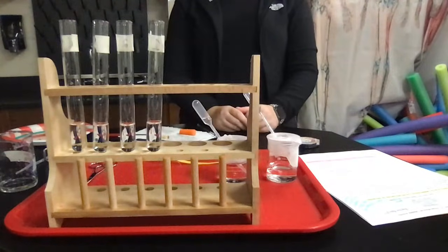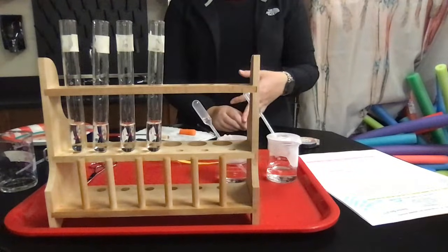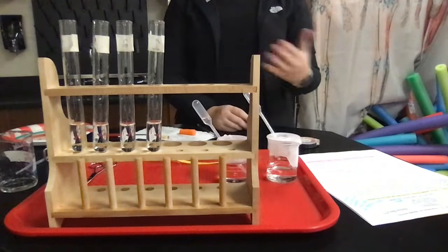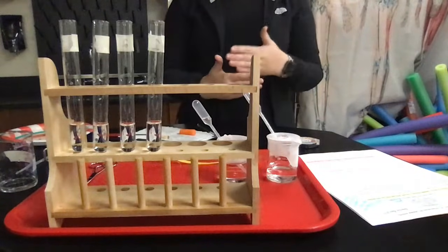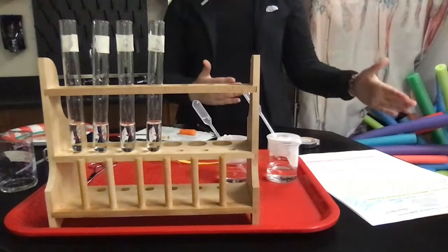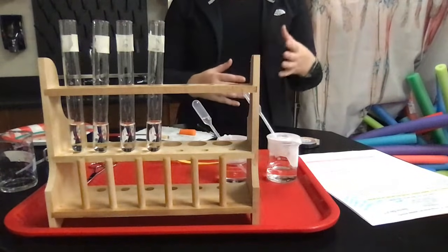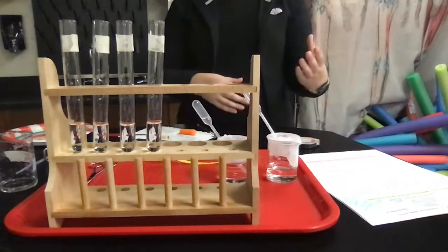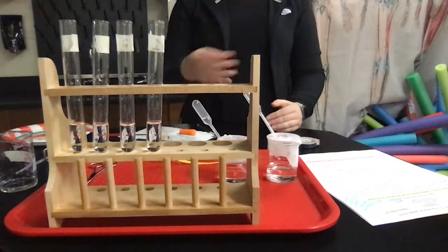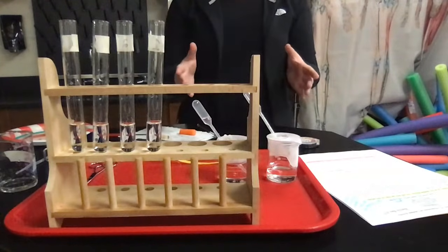So now in part 3, which is the last part of this investigation, we're going to look at the effect of pH on catalase activity. Because remember, this is all about enzymes. Again, you can tell catalase is an enzyme because it ends in -ase. Enzymes are affected by temperature and by pH, which is the environment around them. They have an optimal pH that they function at, and an optimal temperature that they function at. So we're going to see how enzyme activity is affected as you deviate from those optimal requirements.